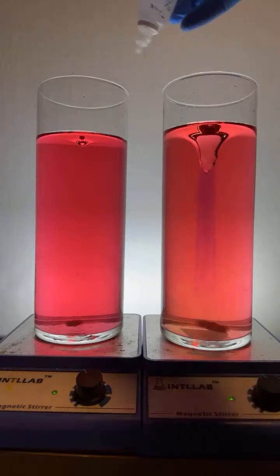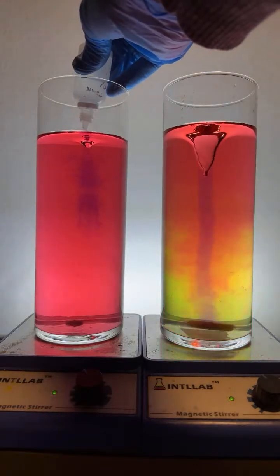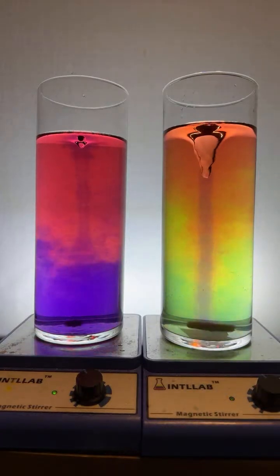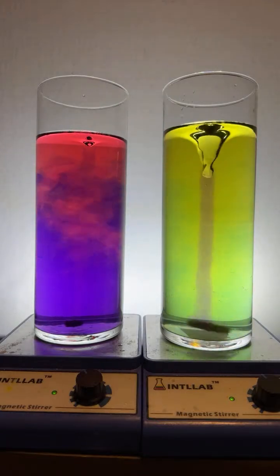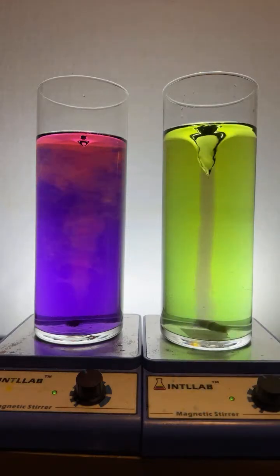Just like the eye of a hurricane is low pressure, the center of this vortex is low pressure, and material doesn't leave low pressure systems. Material moves from high pressure to low pressure. So this low pressure system, the base that I've added, it's pretty much going to stay there.